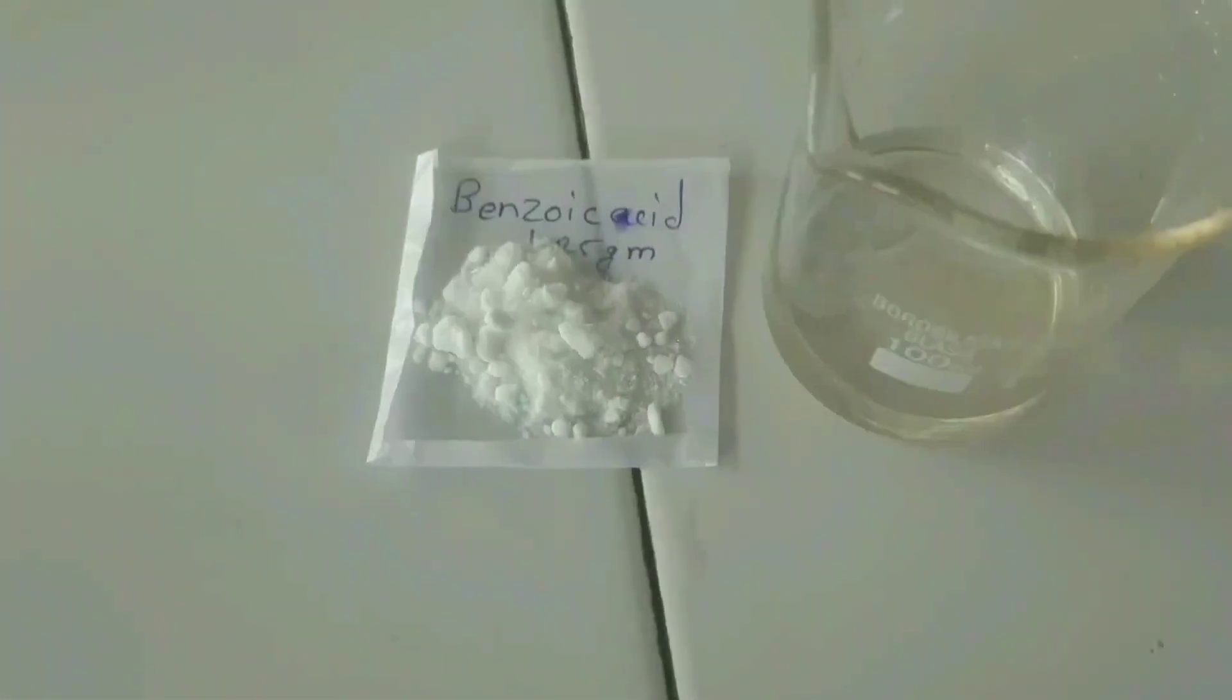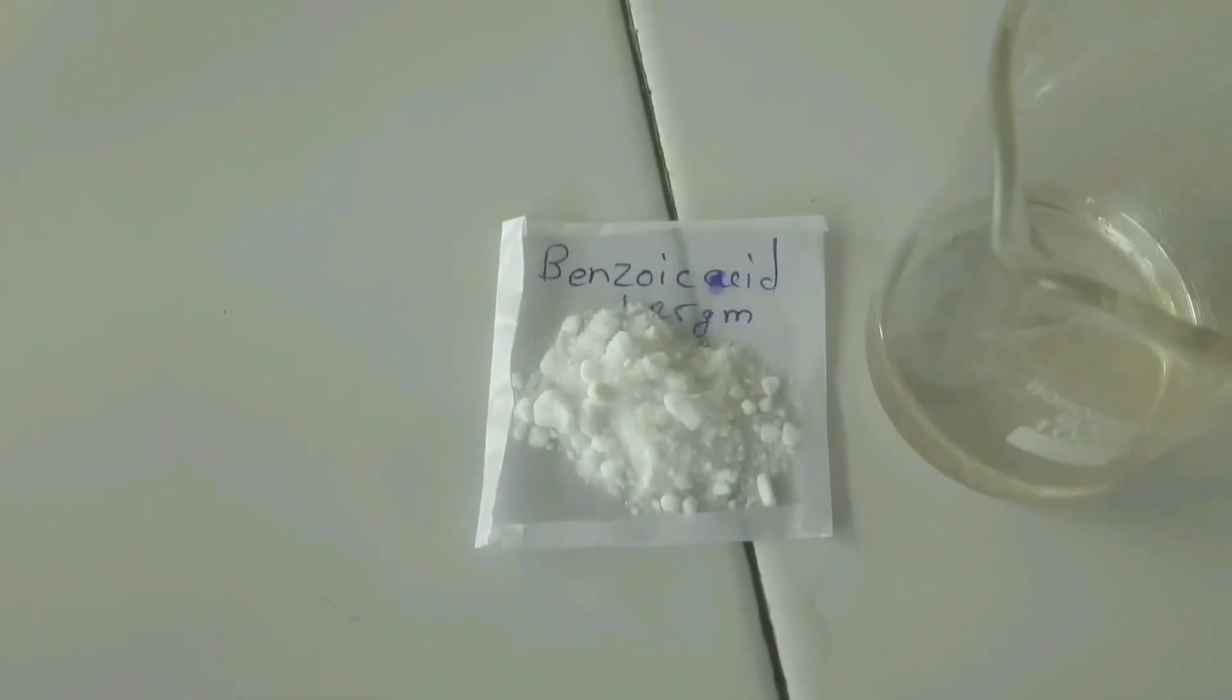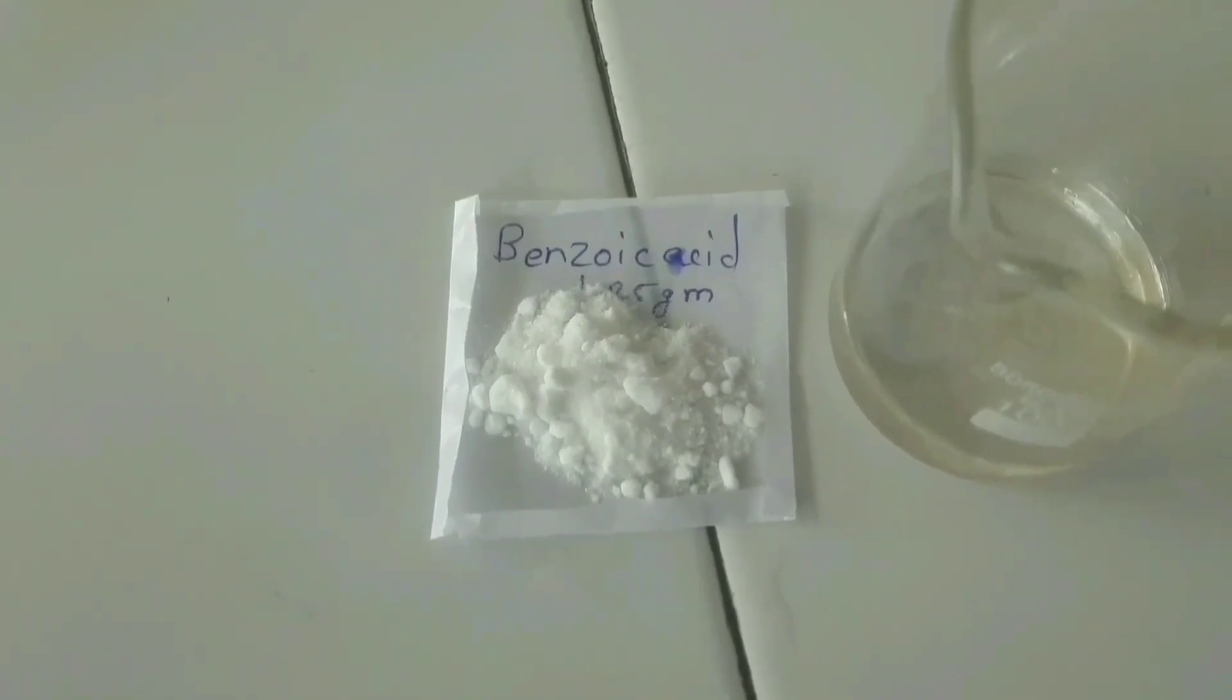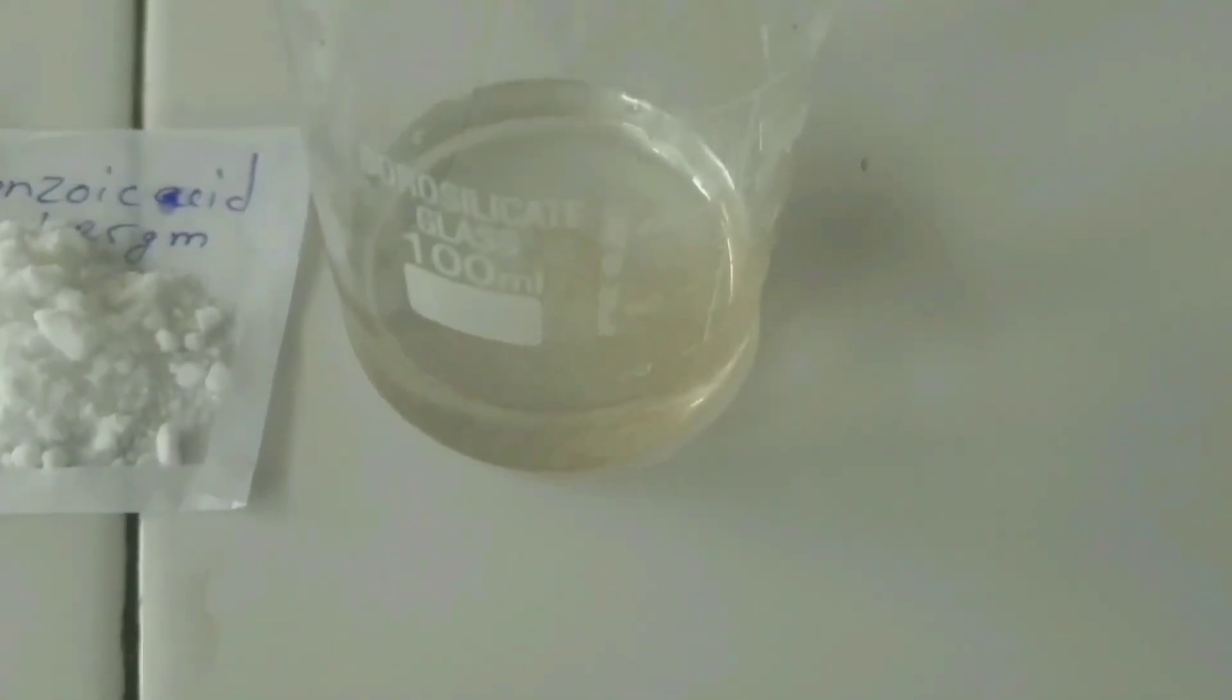Weighed quantity of chemicals: benzoic acid 1.25 grams, propylene glycol 18.75 ml.